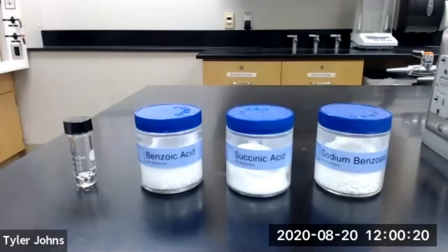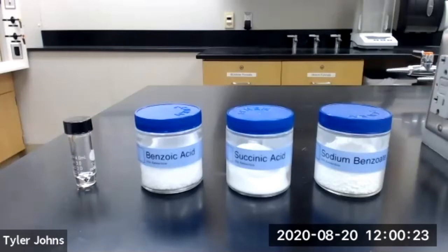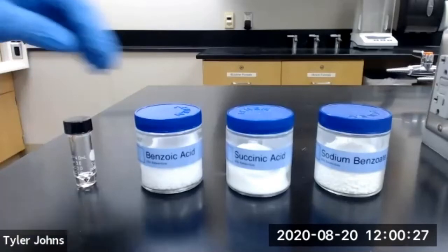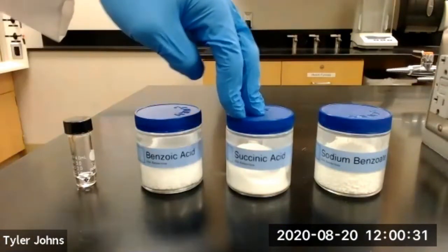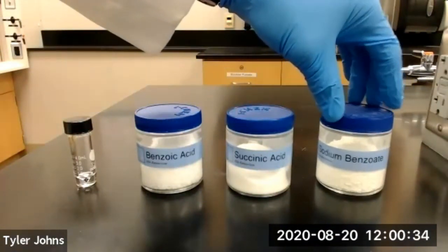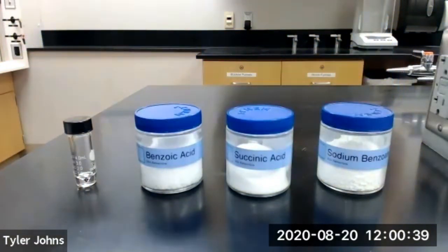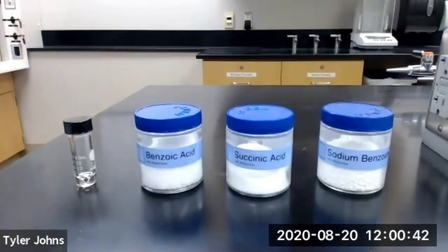In part B of this experiment, we're going to look at the distribution of a solute between two immiscible solvents. In particular, we're going to be looking at benzoic acid, succinic acid, and sodium benzoate, and we're going to investigate how these three organic solids distribute themselves between water and methylene chloride.